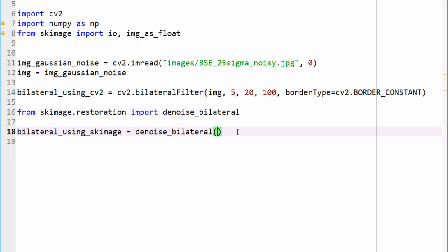So now let's start with our image. Our image is img, and let's skip window size. Let's actually do sigma color. I mean, you can give window size if you want. I'm just skipping this, and it uses the default window. I believe the default window is 3 or 5. You can look at the documentation. Sigma color, again, this is the intensity value that we are supposed to give. And because, again, this automatically converts the image into a floating point, the values must be between 0 to 1. So I'm giving a sigma color value of 0.05.